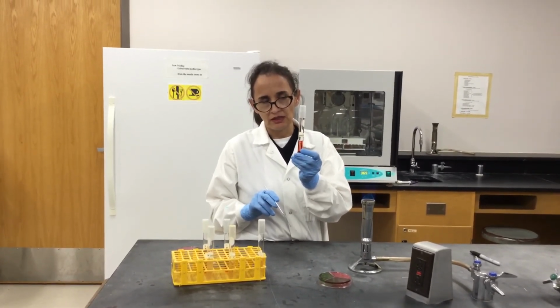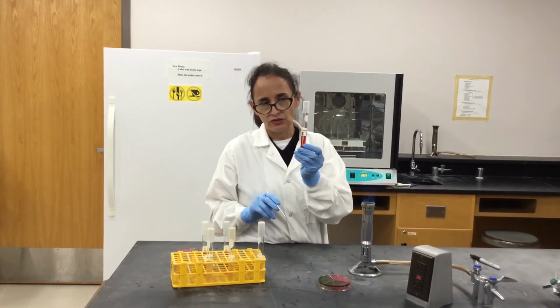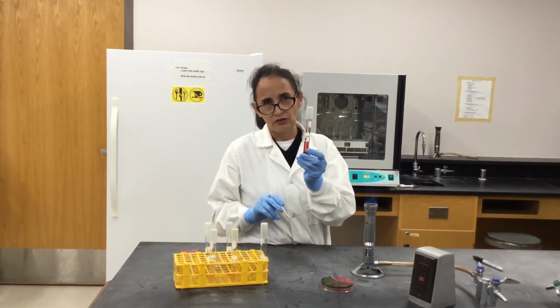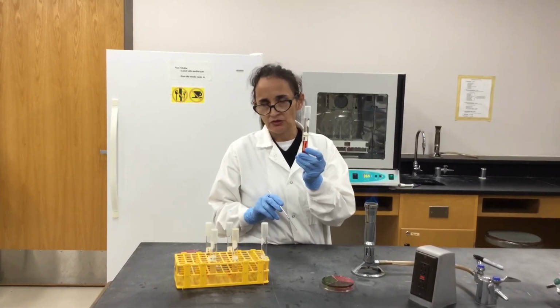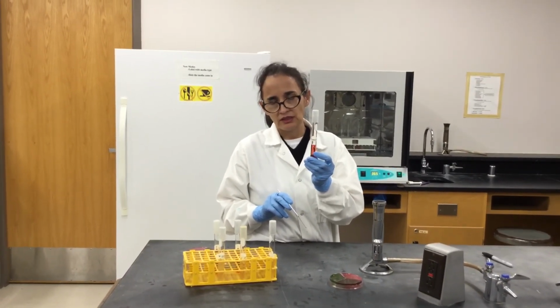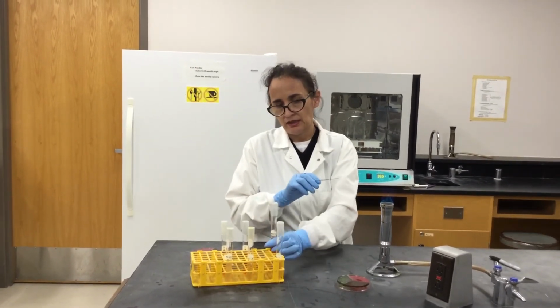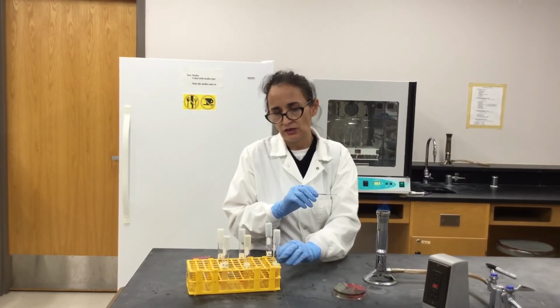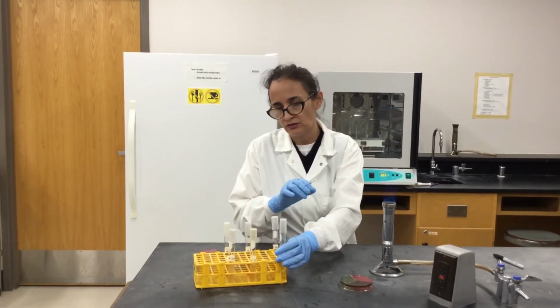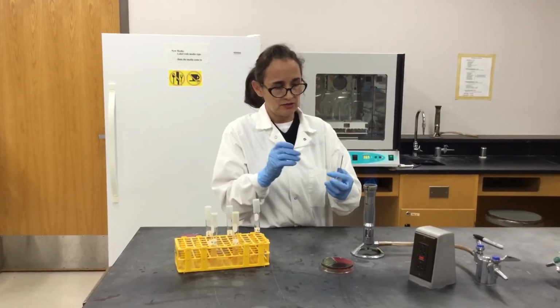But if the bacteria ferments the carbohydrates, the media will turn yellow, and then you will have production of gas, but not always do they produce gas. Some of them are capable of just using these carbohydrates without fermenting, and then they don't produce gas. So they can change the media into yellow, but you don't see a bubble in this Durham chamber.